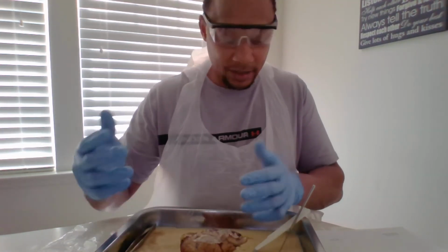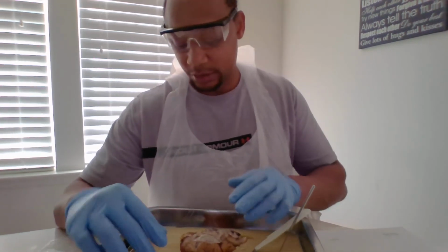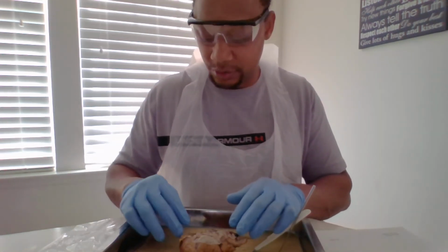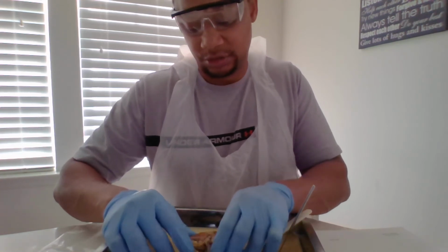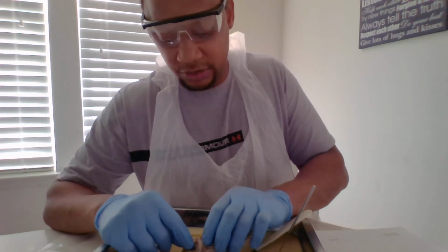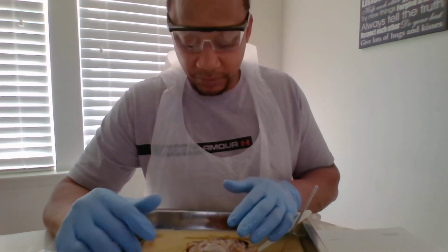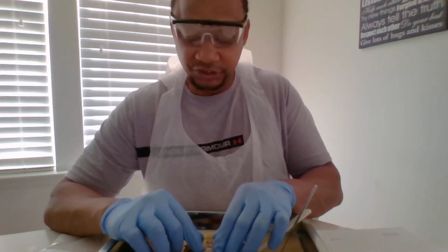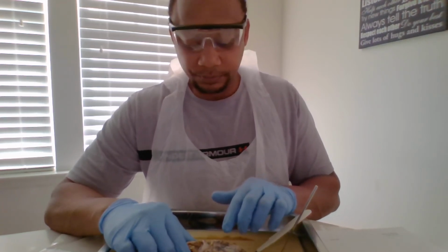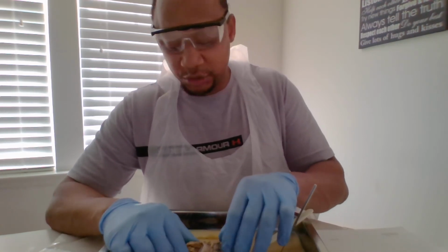And since I'm on the back, the cranial nerves. CN I, which is basically at the top, this top part right here, consists of your olfactory bulbs, which you can see right here, and then your nerves. And then right below that is your CN II, optic, which is basically the top. This chiasm is like the X or connector. The top of it is your nerve, and then the bottom of it, which you can't see.